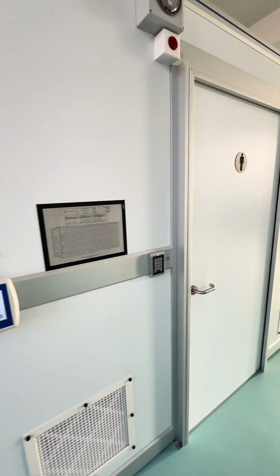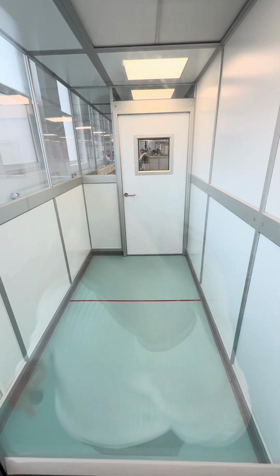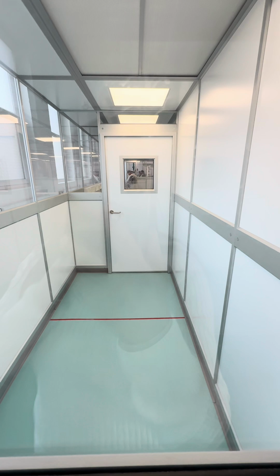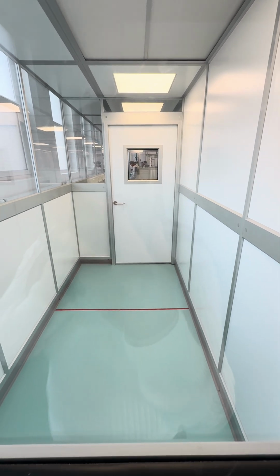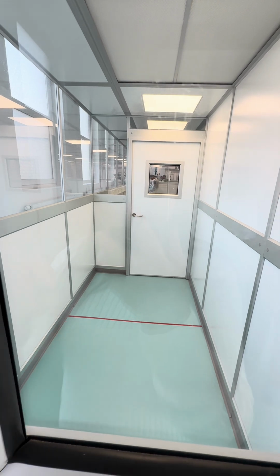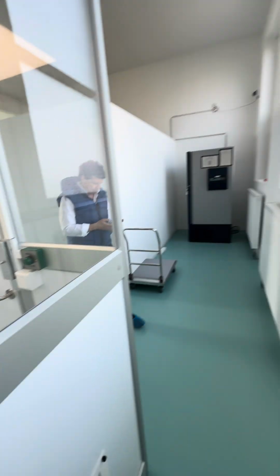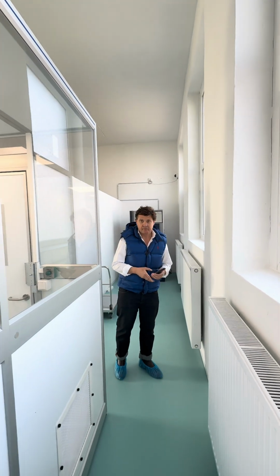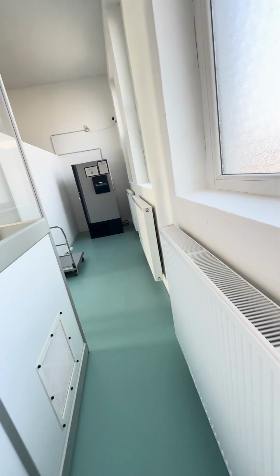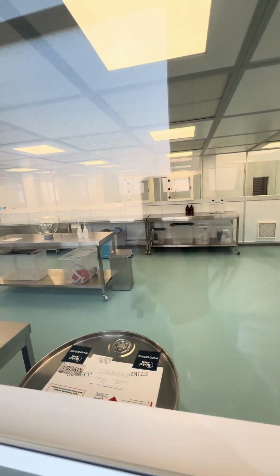Same is here, and the second one is the material transport room. We transport materials from this part until the red line, and someone from the clean room is picking up until this area. Here is the back part of the vault, and we have there a freezer for our ethanol. Here is the production area with all equipment.